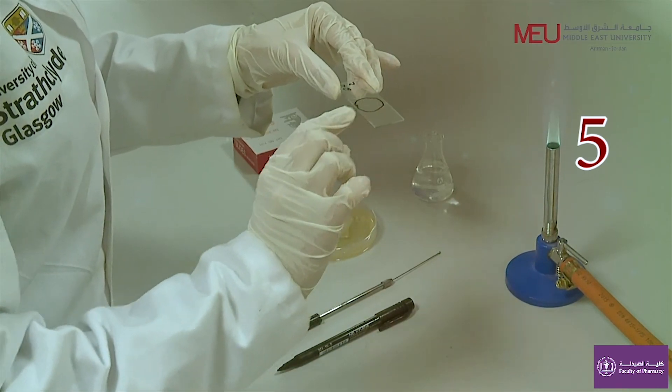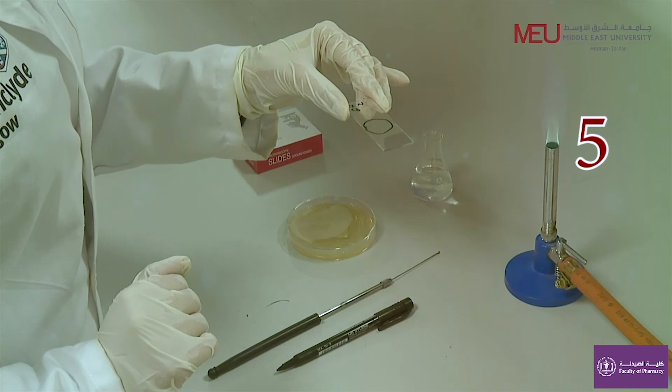After heat fixing, touch the heated portion of the slide to your hand. It should be comfortably warm.